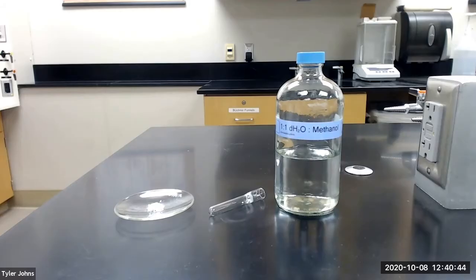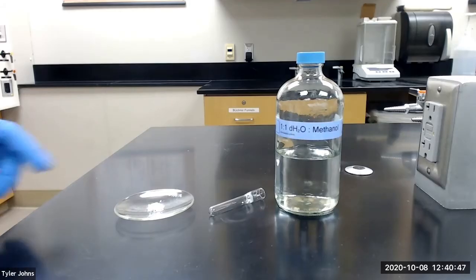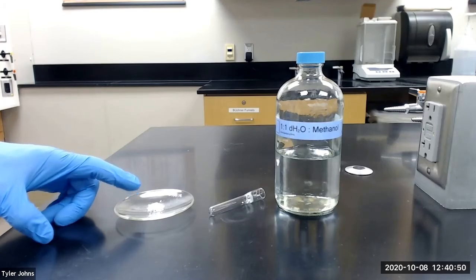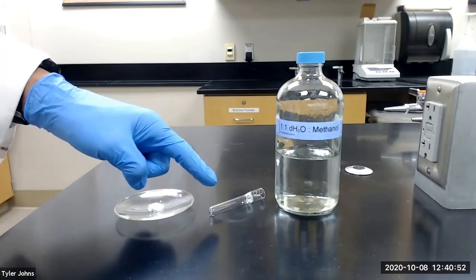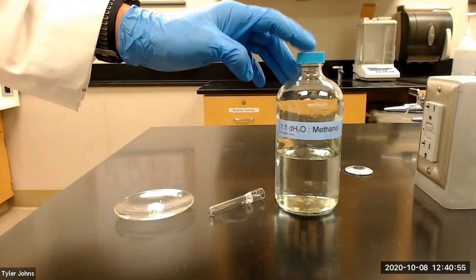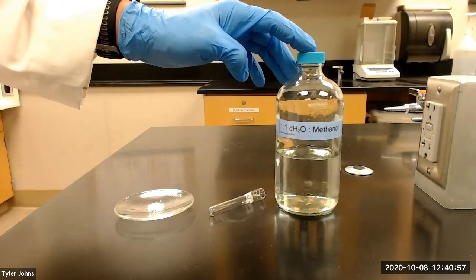We will next perform a microscale recrystallization of our decolored acetaminophen product by placing the product in a Craig tube and using a 50% water, 50% methanol solution as our solvent.